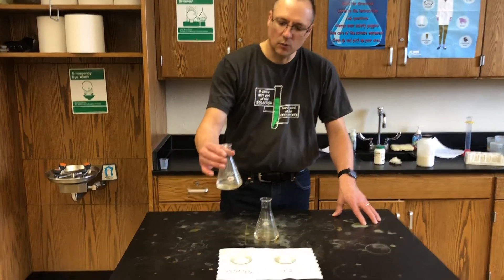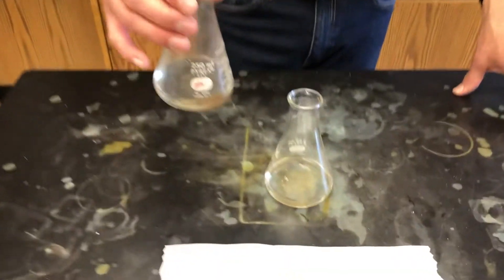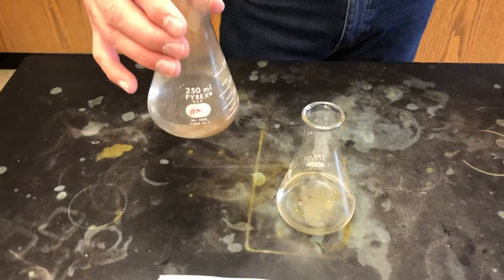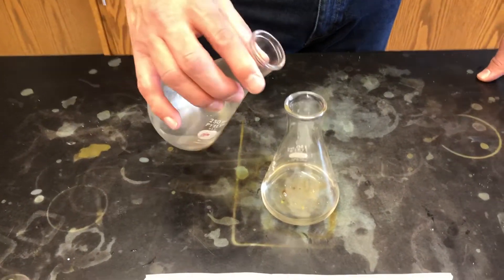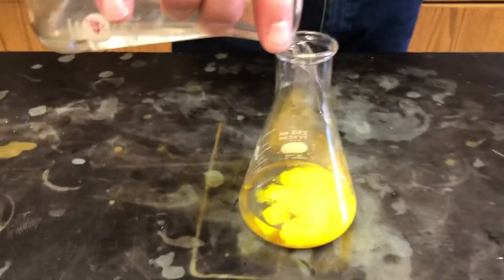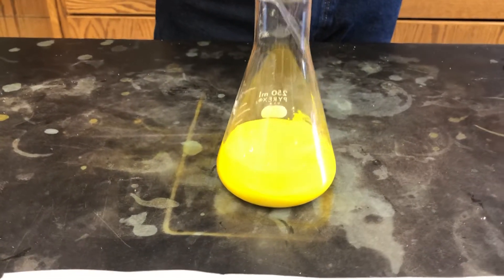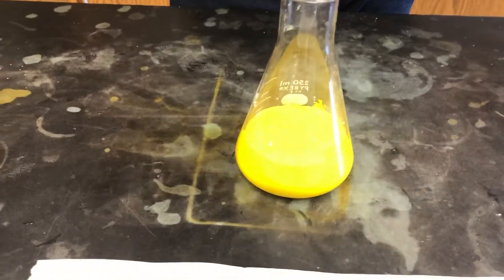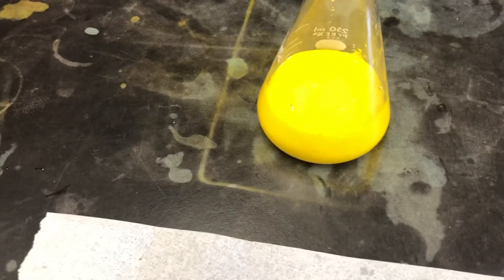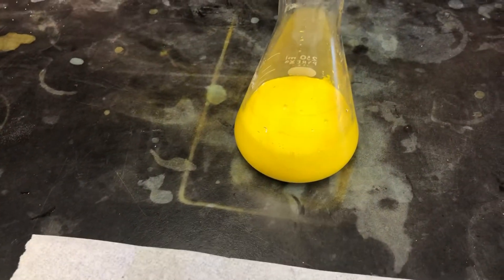So here we go with the lead nitrate, the Pb(NO₃)₂. I'm going to pour that into the potassium iodide, KI. Now as I pour that in, you immediately see that it changed to a brilliant yellow color.